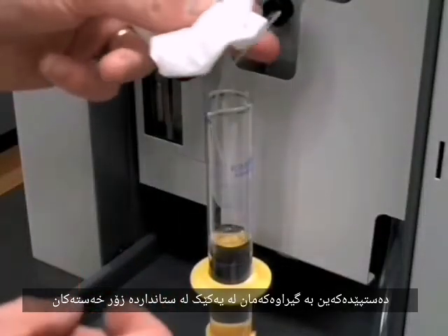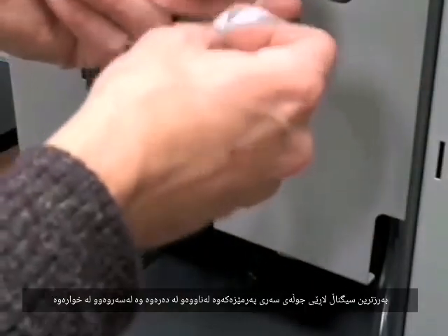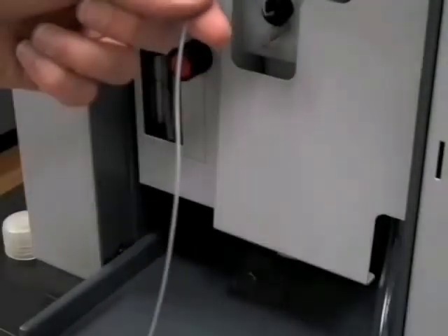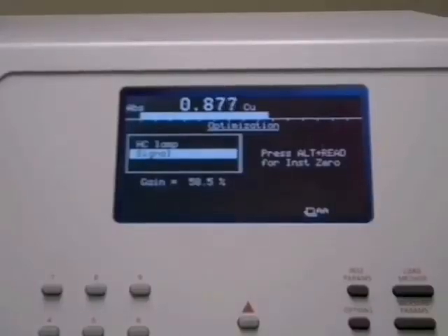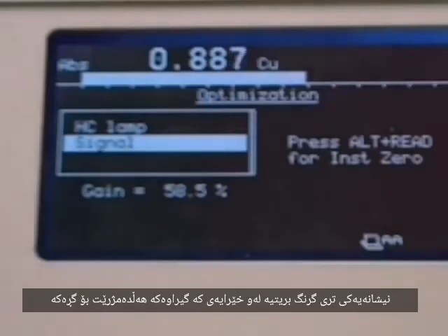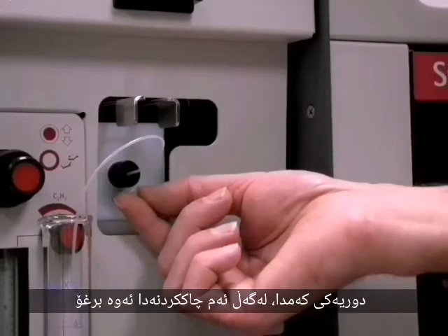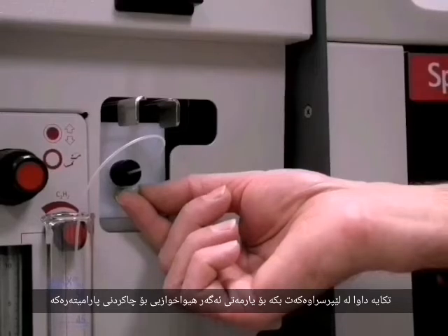Begin by aspirating solution from one of your standards, one of the more concentrated ones. Maximize the signal by moving the burner head in and out and up and down. You may also want to adjust the acetylene ratio. Another critical feature is the rate at which the solution is aspirated into the flame. This can be controlled by moving the needle for the spray nozzle small distances with this adjustment screw. Please ask the instructor for help if you wish to adjust this parameter.